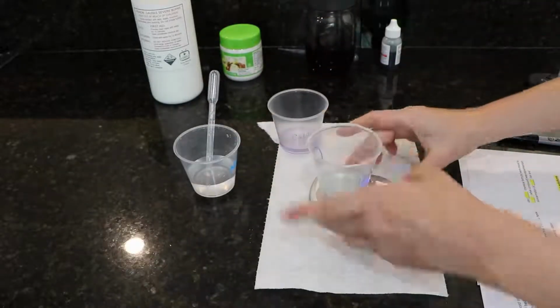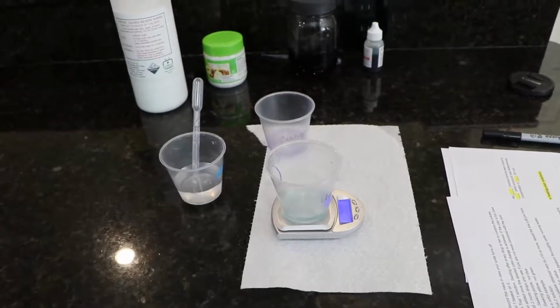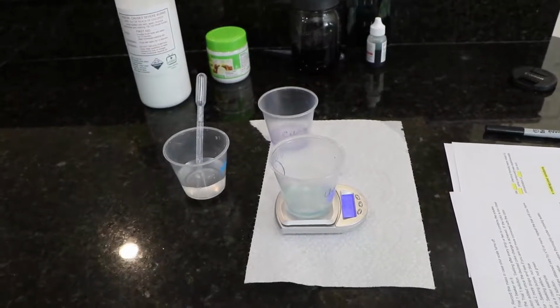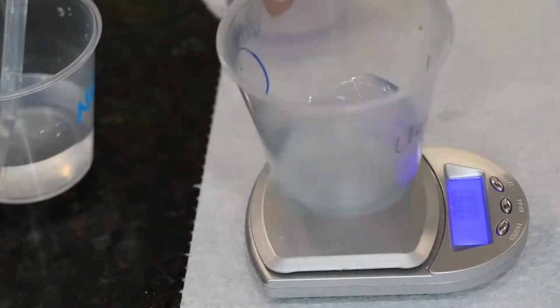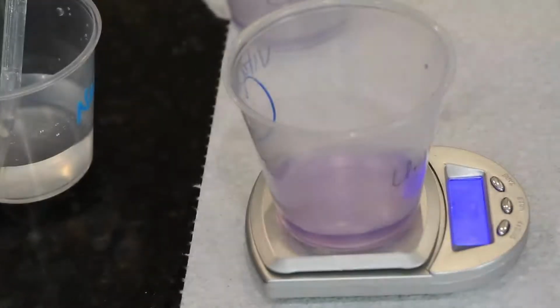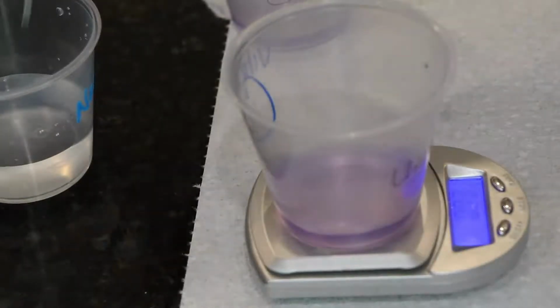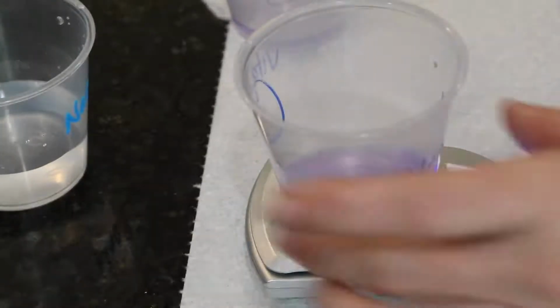And then we're going to titrate, and we're going to titrate by mass with this one. So you're going to put your trial beaker on the scale and tare it. Then I'm going to zoom in to show you, because with the Universal Indicator, it's possible this will only take one drop. It depends on how you made your solutions. So I'm going to show you, see how it went from blue to purple? That one drop, that mass, needs to go in titrated mass 1.